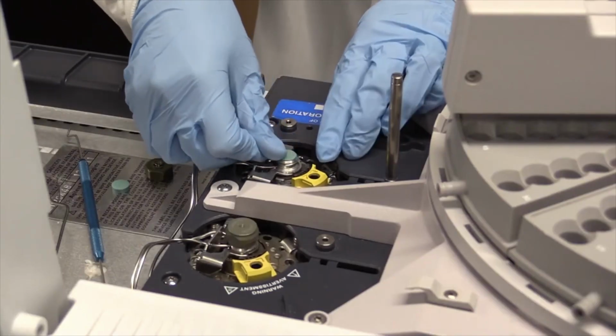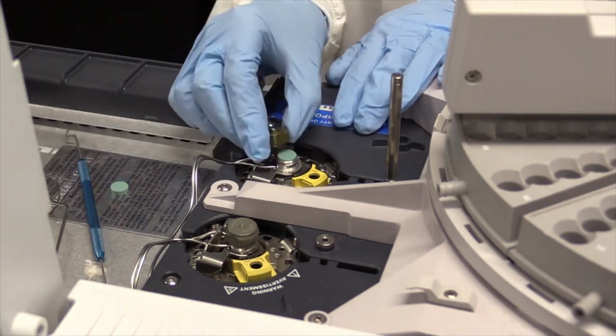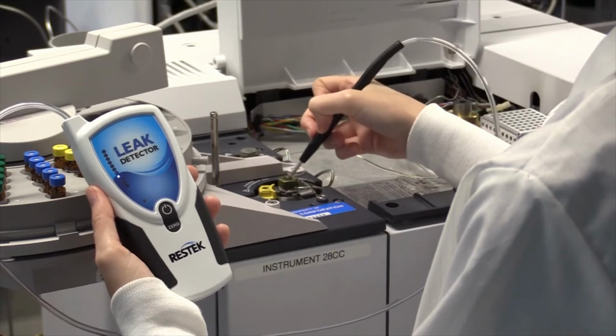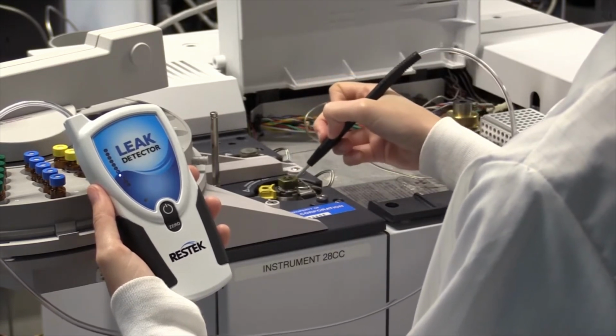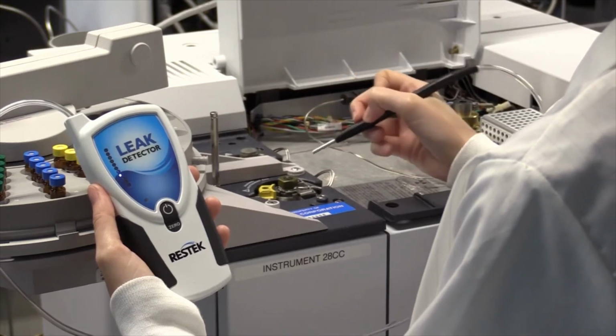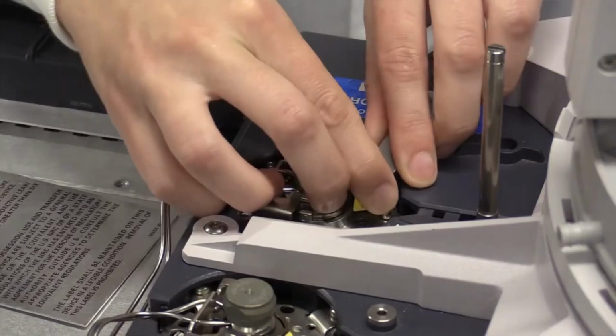You should leak check your gas delivery system and instrument, especially the critical seals, on a daily basis. The septum is a common source of leaks. If the septum is leaking, simply replace it. By checking the septum regularly, you will be able to learn how long your septum generally lasts, and then avoid unplanned downtime by anticipating when to change it before it starts to leak.